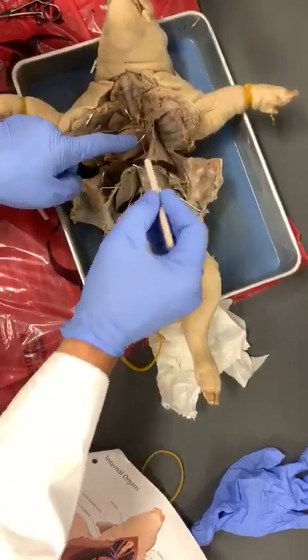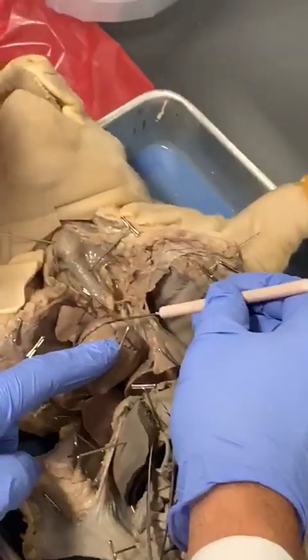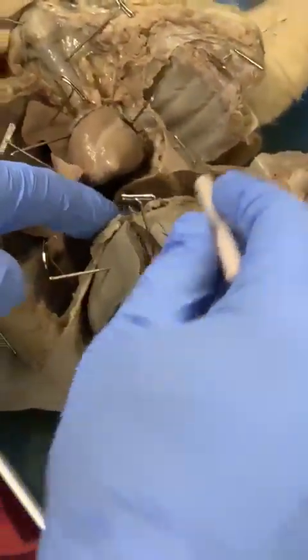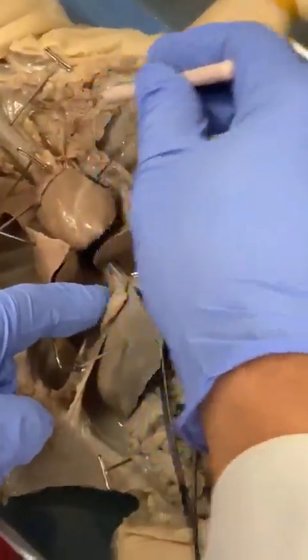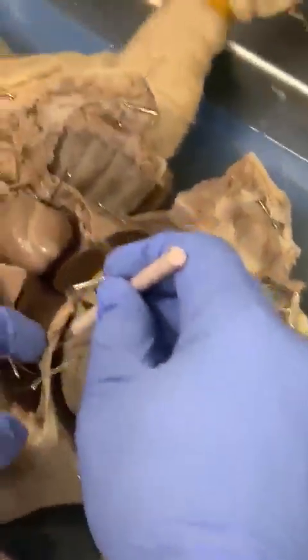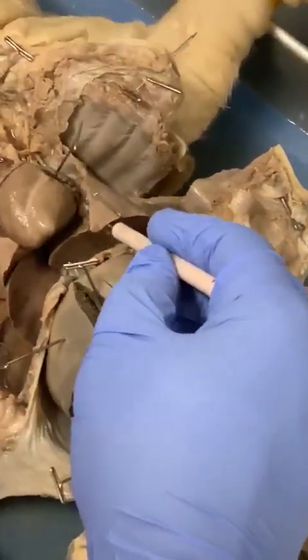And then if we move the heart to the side here, we are going to see the aorta and the pulmonary trunk. Underneath here, we're going to see the esophagus. So you have the trachea all the way to your lungs, and after that, the esophagus runs underneath. Esophagus here, and it's going to bypass. This is your diaphragm. The diaphragm is actually the muscle there. Oh, I forgot to tell you about this, the pericardium.